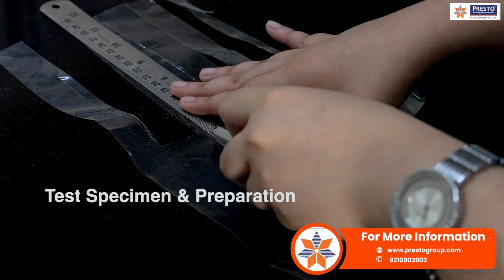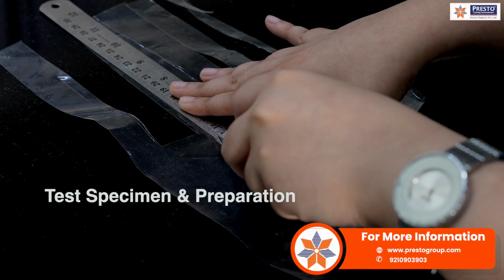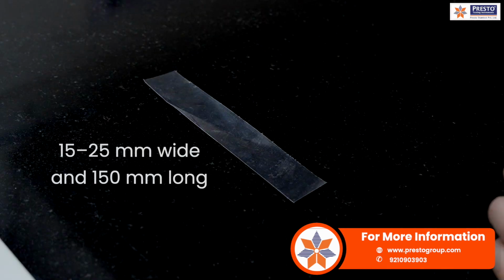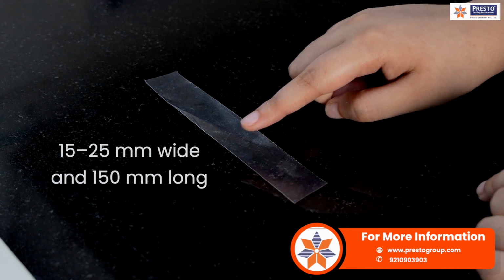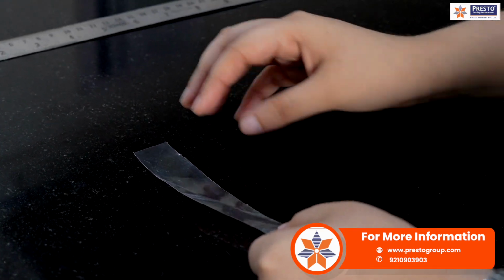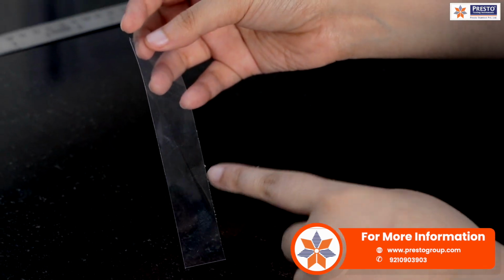So now we will understand how to prepare the specimen for the testing. The test uses strips of plastic films, usually 15 to 25 mm wide and 150 mm long. The thickness should be less than 1 mm. Specimens must be cut precisely, aligned in the same direction, machine or transverse, and conditioned at standard lab conditions.